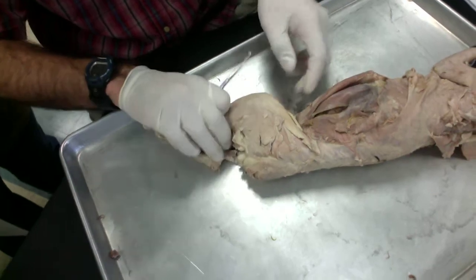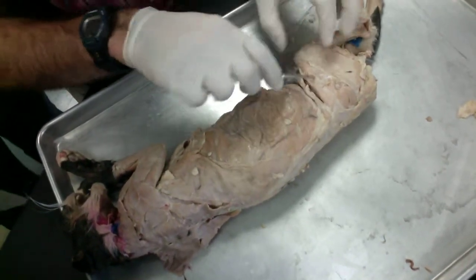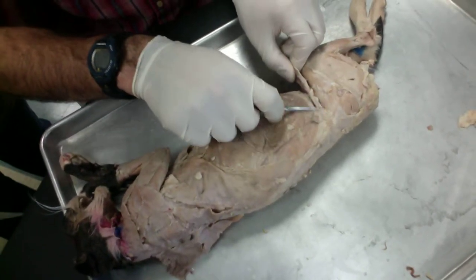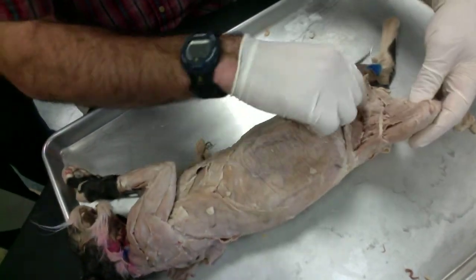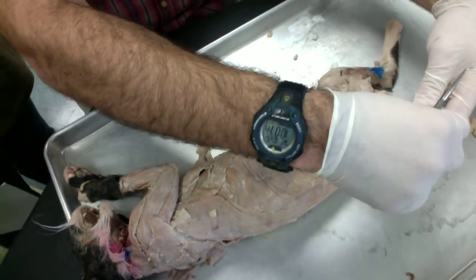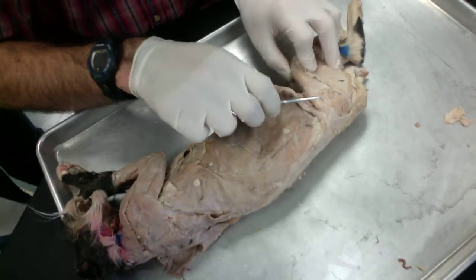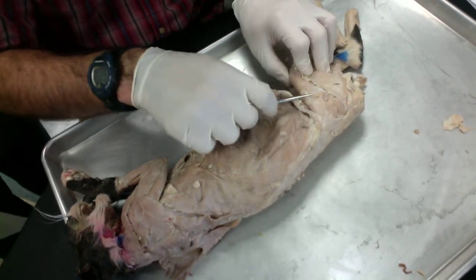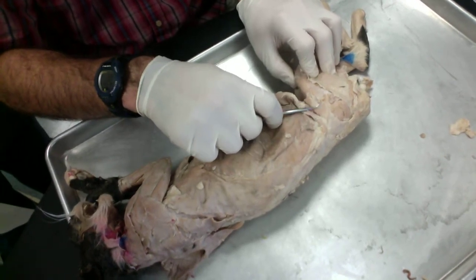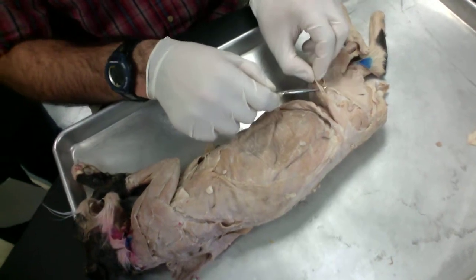Okay, so moving on to the hind limb here. Let's take a look at this first muscle. When you're looking at it from the lateral side, if you open it up, you can see that it's actually this big, wide, thin muscle. That's the sartorius. Then you've got your gluteus medius up here. You've got your tensor fasciae latae here. And then you've got your connective tissue, your fascia lata, down here, a little bit lower.